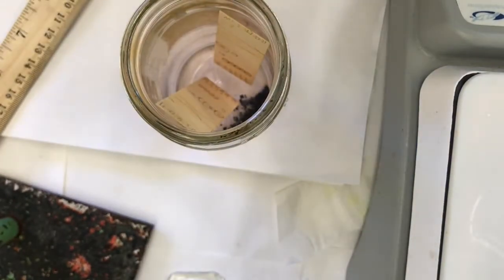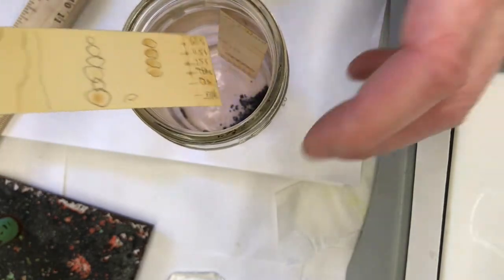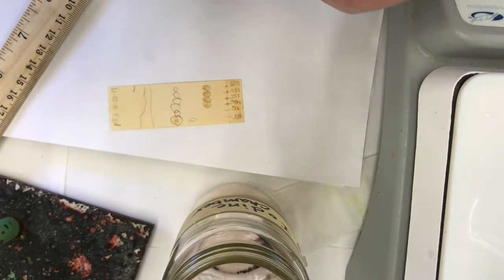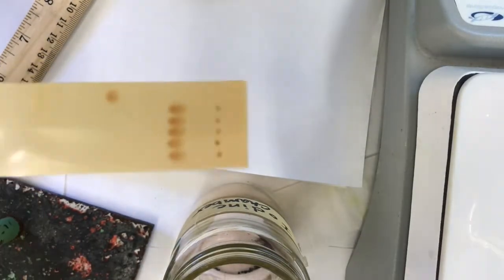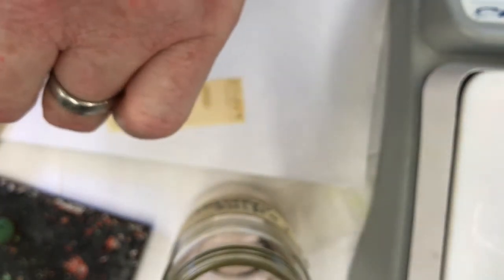Open this up. Oh yep, some spots turn purple. That's interesting. I'll get both out. I noticed something: sometimes when you're trying to visualize spots like this, it's nice to look through the back of the plastic. It's maybe a little bit clearer at times, so that's another option. So let's go back here so you can see the iodine's showing us some new stuff.